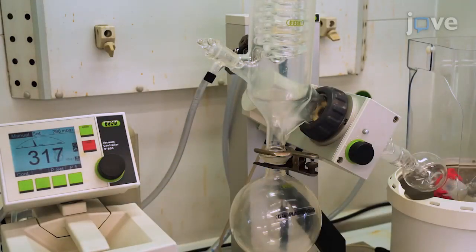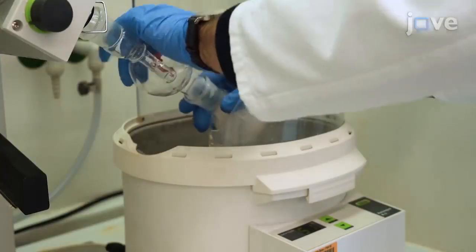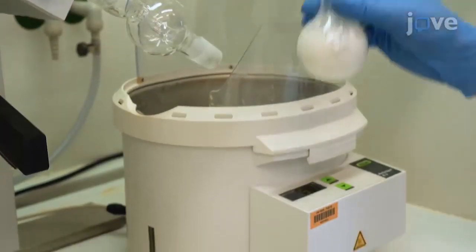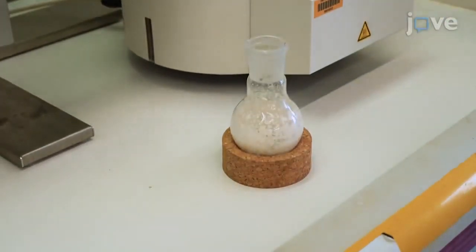Let the solution cool to room temperature and remove the solvent with a rotary evaporator.